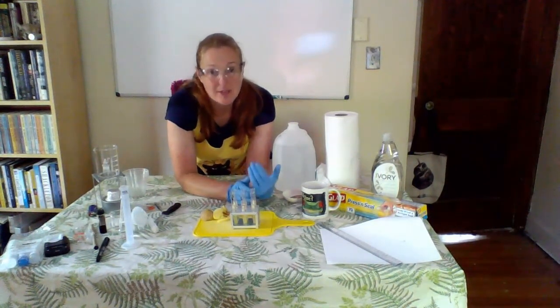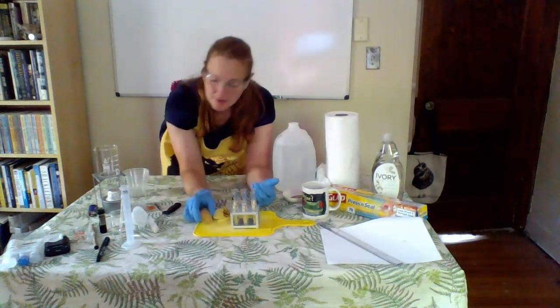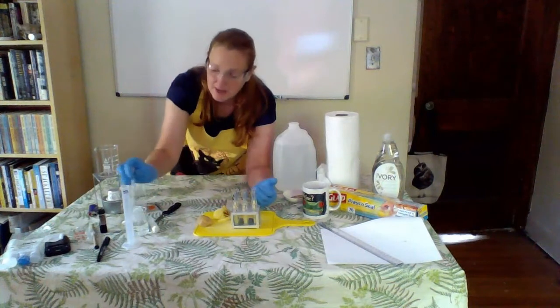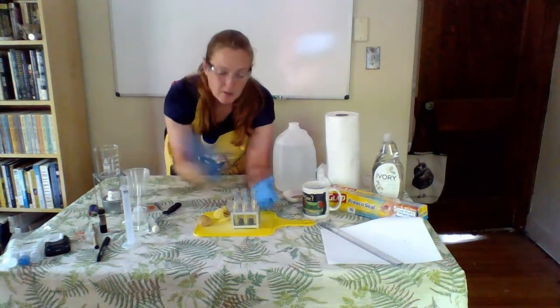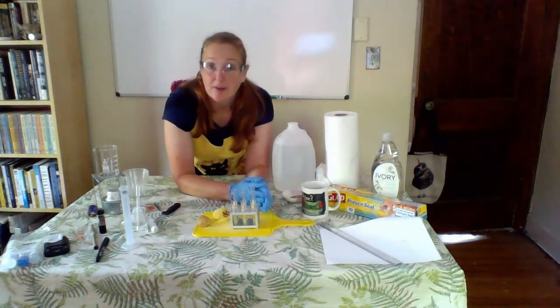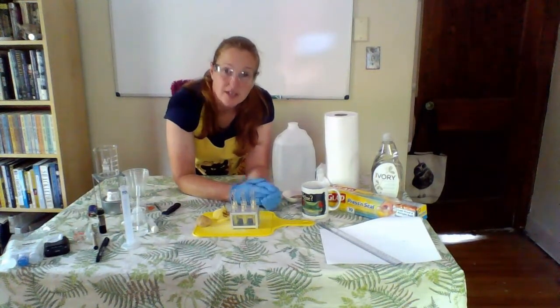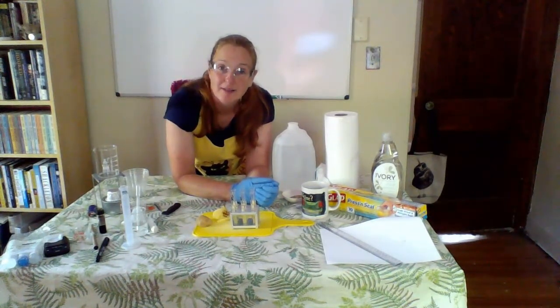So, we've got the same type of test tube. I used the same potato for all of my little French fries. I used the same sugar and mixed up the sugar concentration in the same beaker. I used the same pipette for distilled water and the same pipette for my sugar solution when measuring everything. I made sure that all the volumes in all of my test tubes were the same and that all of my little French fries were all the same. I held everything constant. So my independent variable, my concentration of sugar, is the only thing that I have changed in every single test tube. And that should influence my data, my dependent variable, at the end of experiment 1.